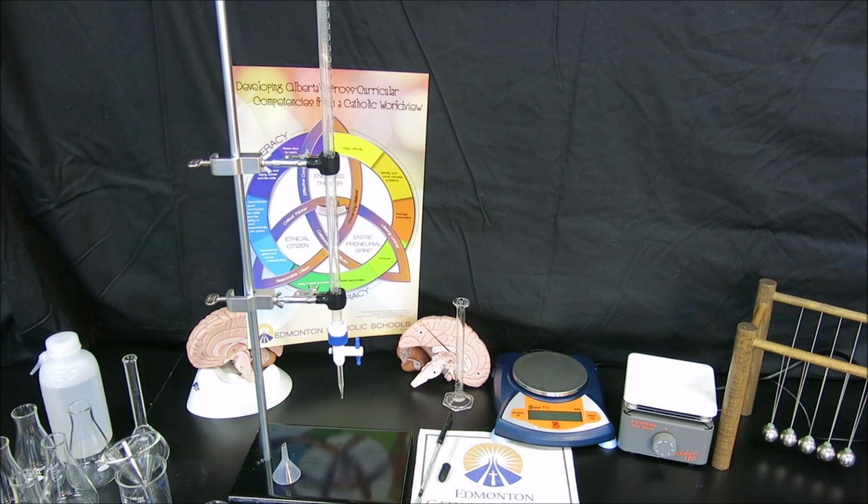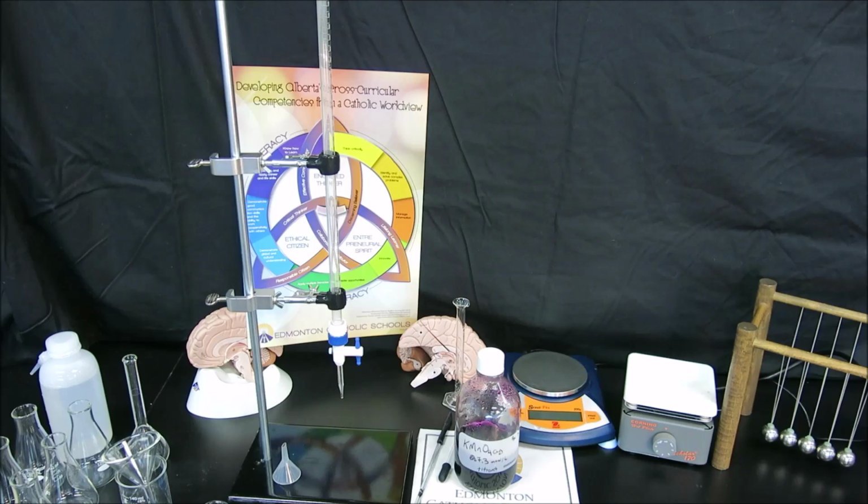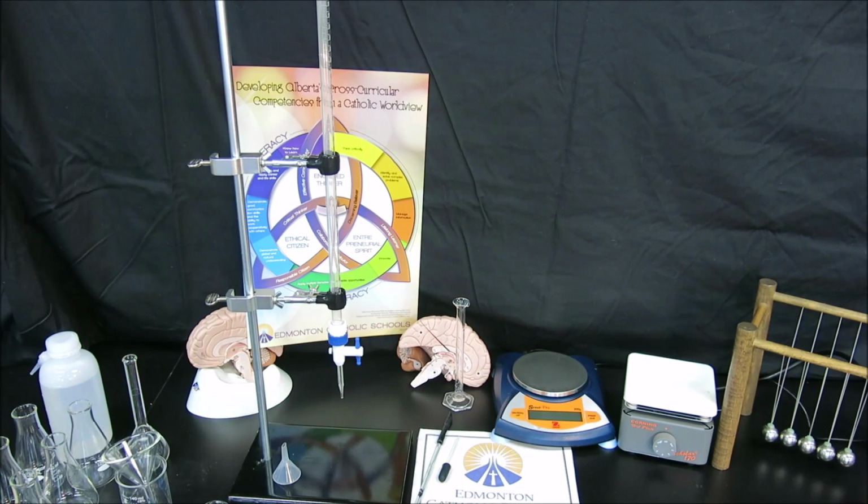Being a redox titration, we need to make sure that our titrant has not either reduced or oxidized, depending on what it is. In our lab here, we're going to be using potassium permanganate, which is a strong oxidizing agent when acidified. Nevertheless, it could slightly change its concentration over time, and because this is a solution off the shelf, we need to standardize our titrant.